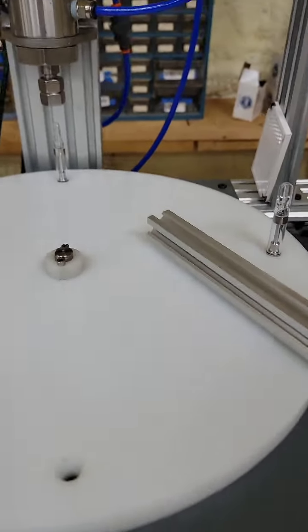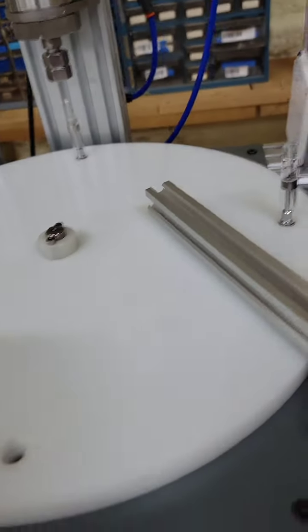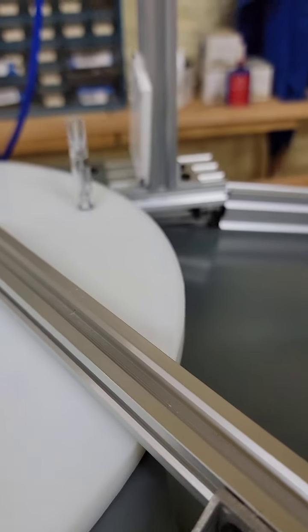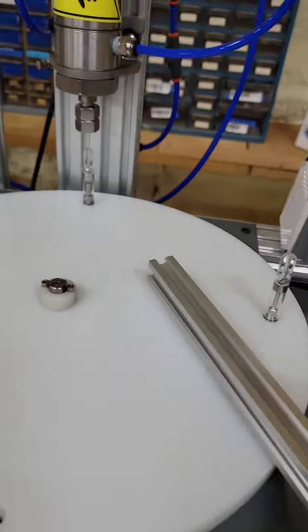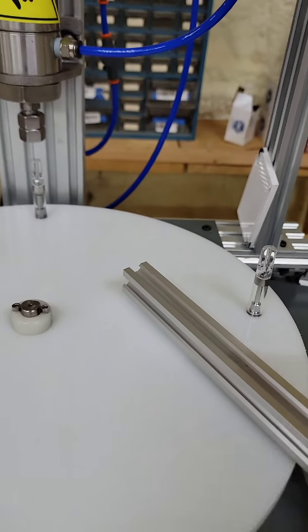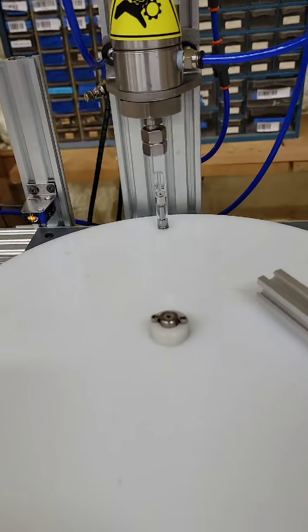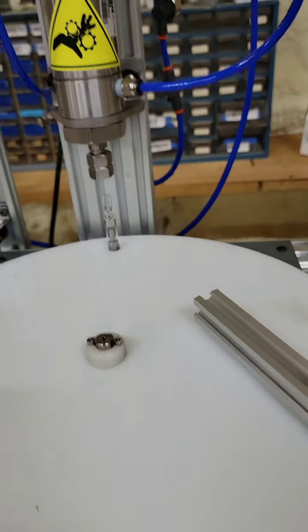As far as ejecting, we're using air pressure. So, you might need to turn it up a little bit. Right now, I just have it kind of popping out of the hole like that. Every once in a while, you might have one that gets stuck or doesn't eject. If that happens, it's okay. Just pull it out and keep going.